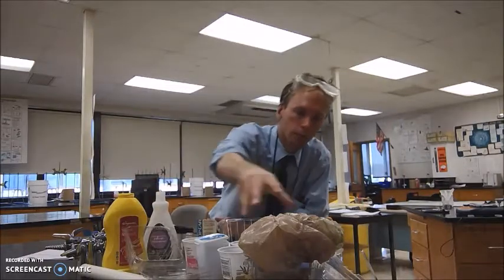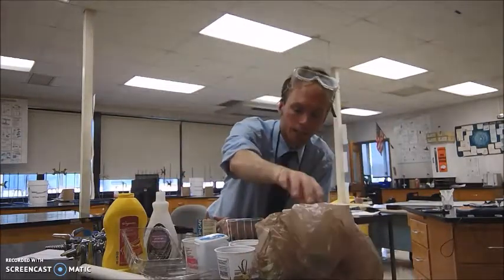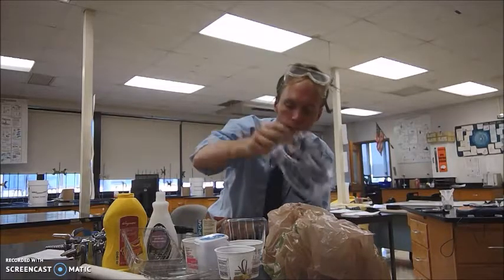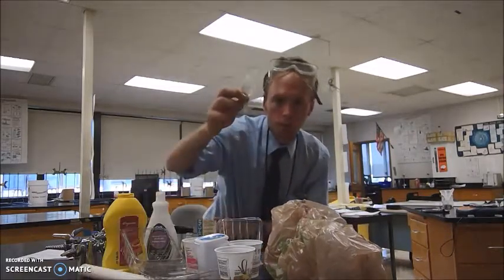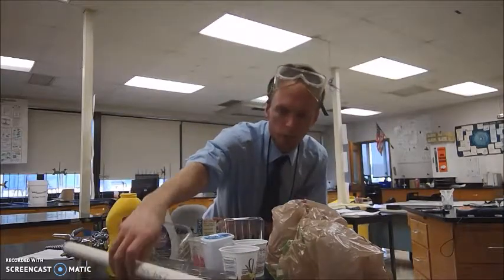I have a variety of substances in front of me. I have a mustard container, containers you can get your fruit in, disposable plastic bags, pop rings or six-pack rings, plastic silverware or plastic utensils, PVC pipe, and all these things have in common that they're plastics.